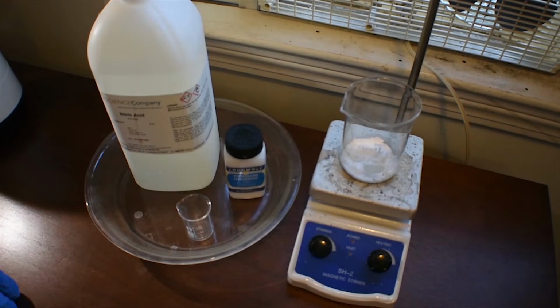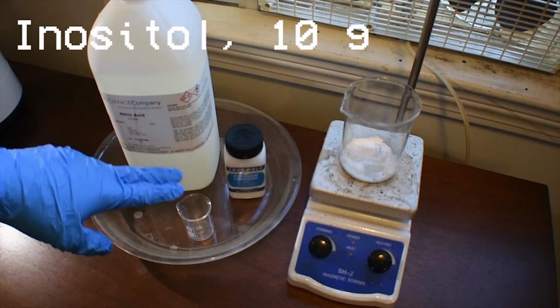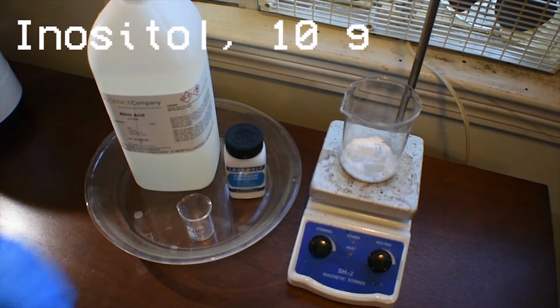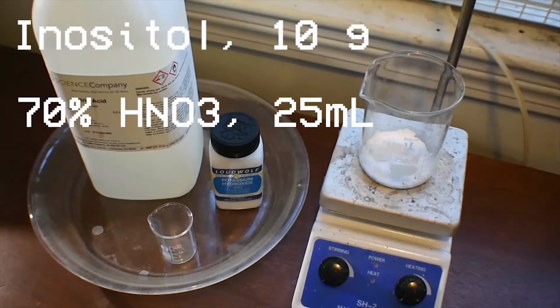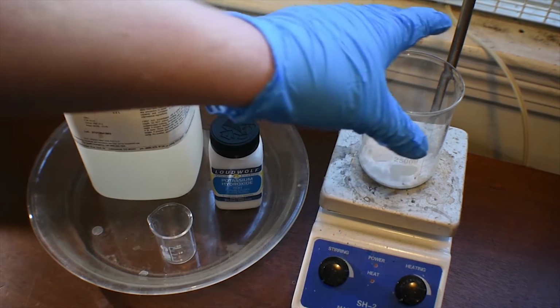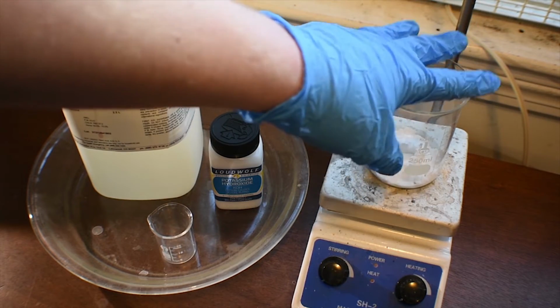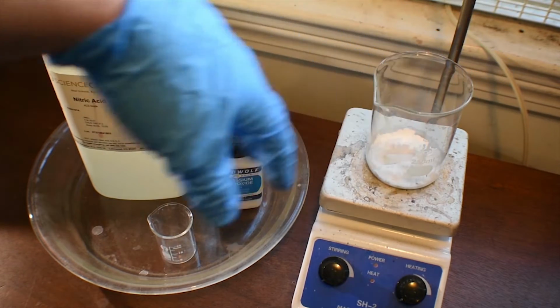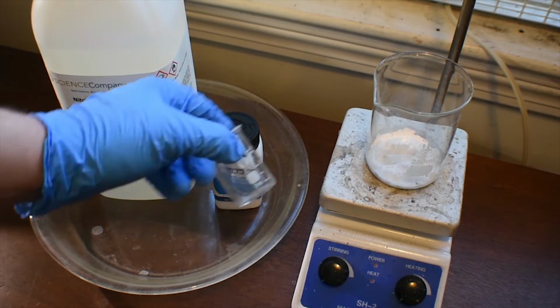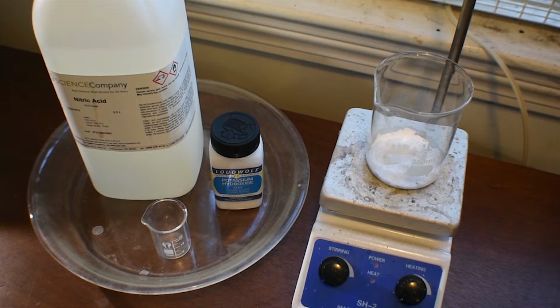Okay, so the amounts you will need of each are 10 grams of inositol, 25 milliliters of 70% concentrated nitric acid, and 40 grams of potassium hydroxide. Now, the way you're going to add this is you're going to get your 10 grams of inositol on a stir hot plate, and you're going to add 25 milliliters of the concentrated nitric acid to this. No reaction should occur unless your nitric acid is hot already.